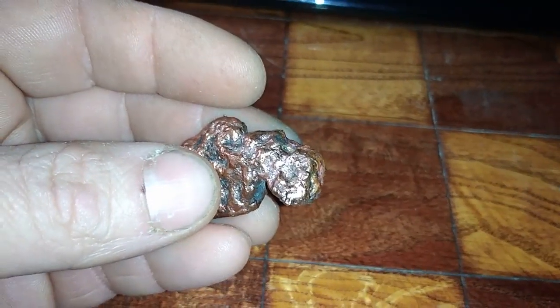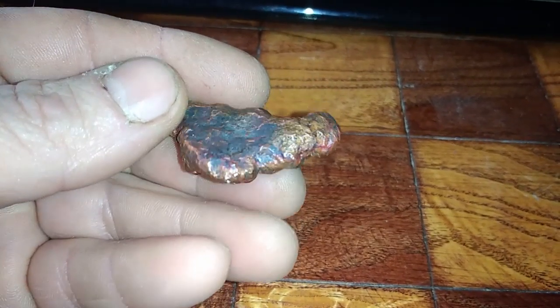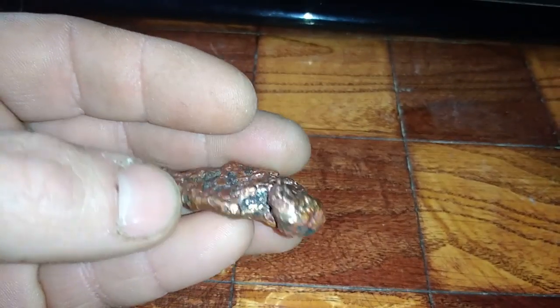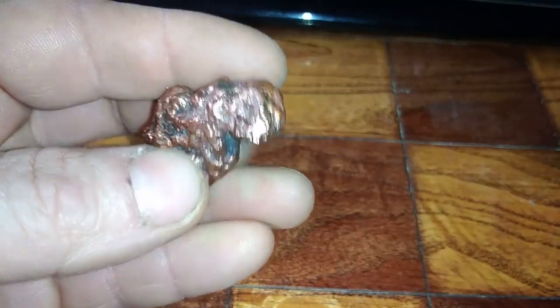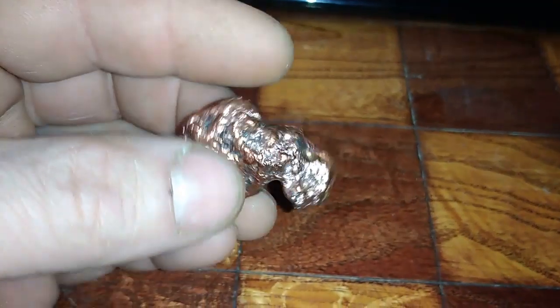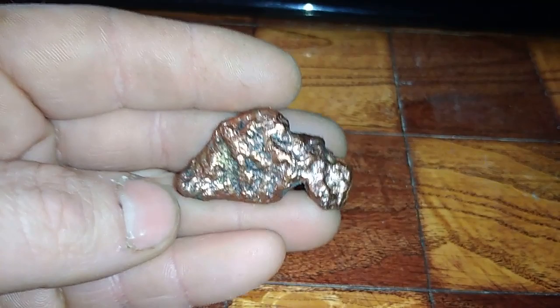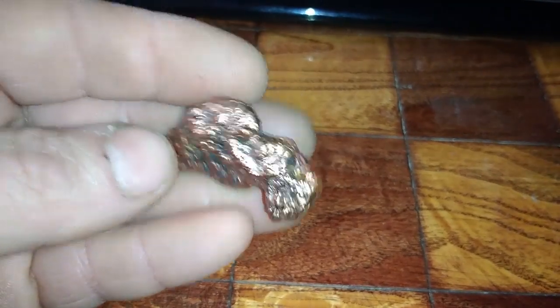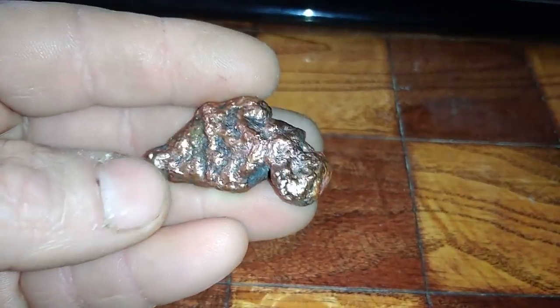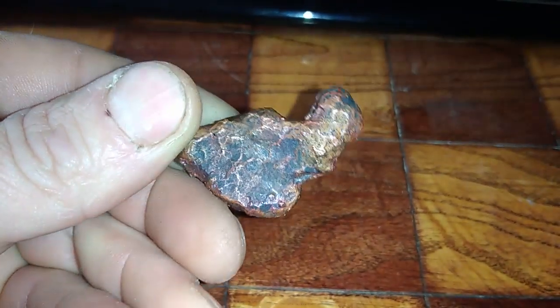This copper popcorn is a mix of different metals from the motherboard. I got this little sample for the purpose of testing — this is 26 grams of copper. Inside we have different metals, but maybe it contains some gold, maybe some palladium. Who knows? Because this is from different types of boards — maybe if I get lucky I will have some gold, platinum, or palladium from it.